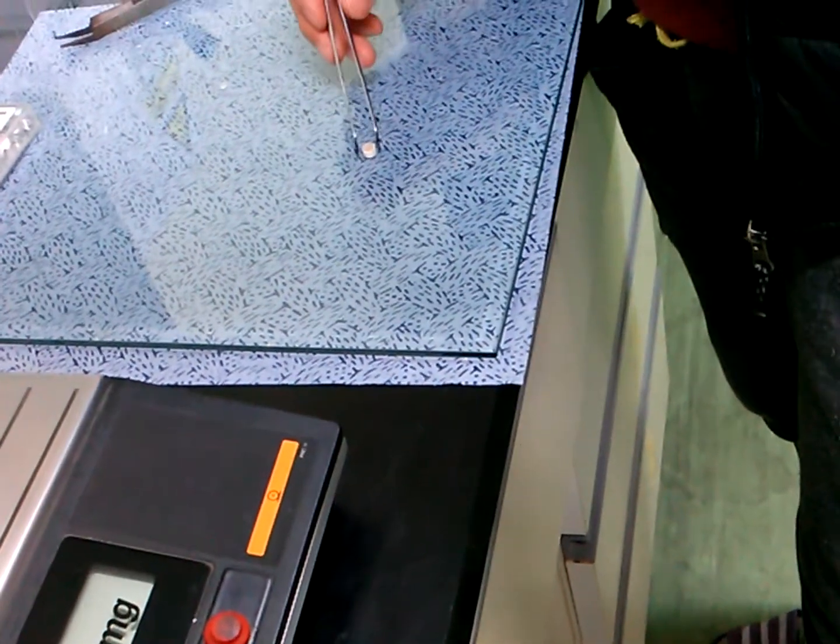I think your sample is barely enough — only one? Usually we use a sample weight of 10 milligrams. It must be 10 milligrams, or can be lower or higher — that's okay. It's a beautiful sample. And then check.